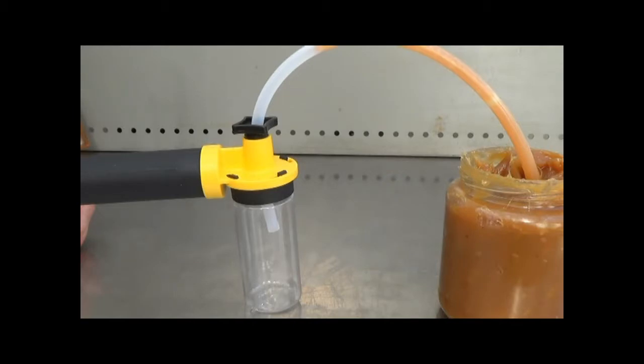If you prefer you can collect the grease already in the tube instead of in the bottle. Just cut the tube, seal the ends, put it in a jiffy bag and send to the lab.